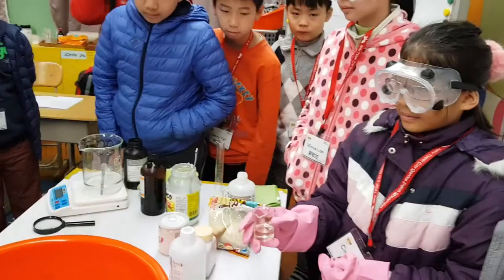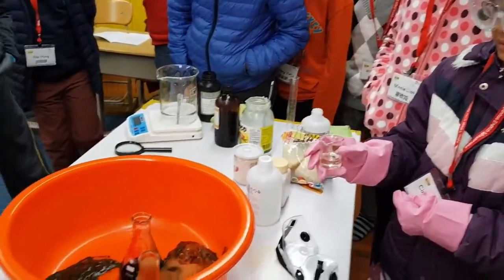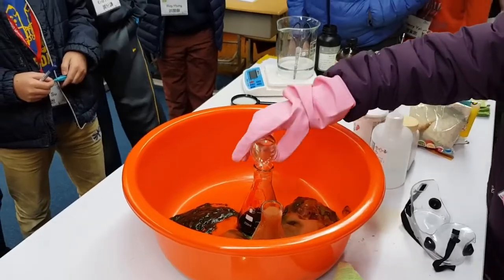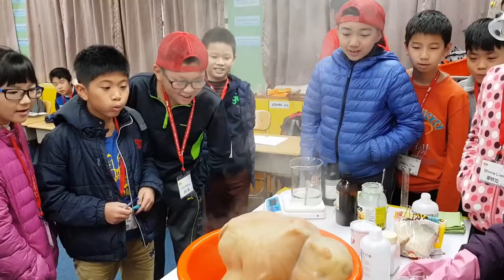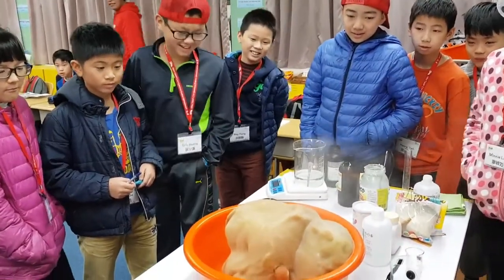You're right. All right. I want you to pour it fast. Go. Fast. Back up. Whoa. Don't touch.